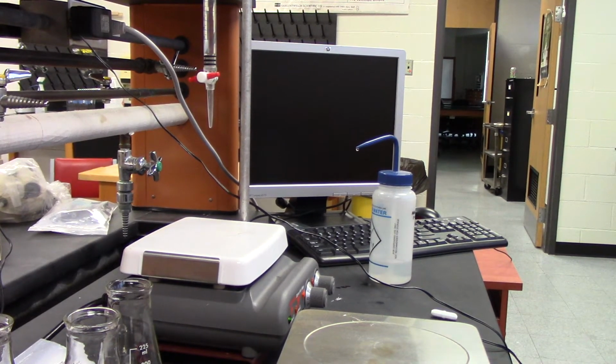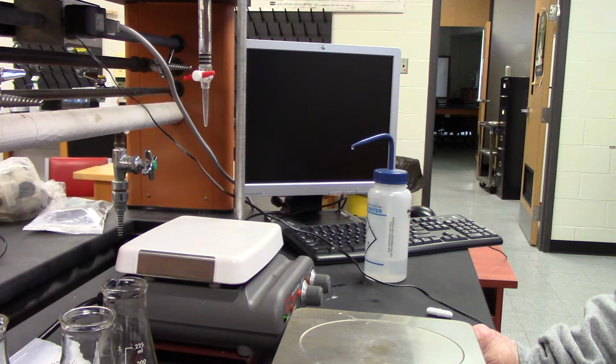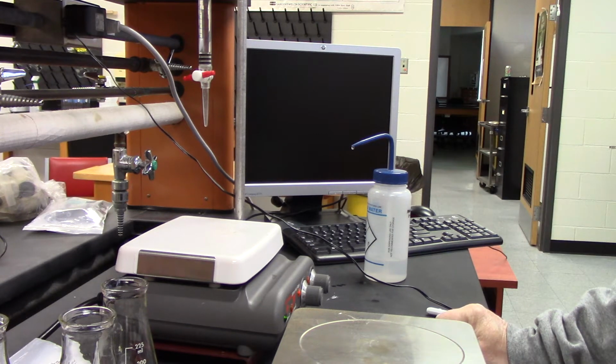Okay, so in this lab we're going to figure out the molar mass, or the molecular weight, basically the same thing, of an acid. We're doing a similar experiment to the one we just did with vitamin C, finding out the pKa and finding the molecular mass of an acid. All three experiments need a standardized solution of sodium hydroxide, and I have a video that showed how to do that.